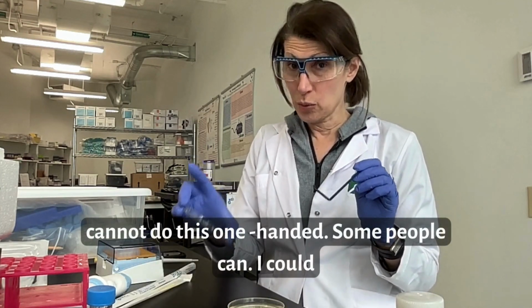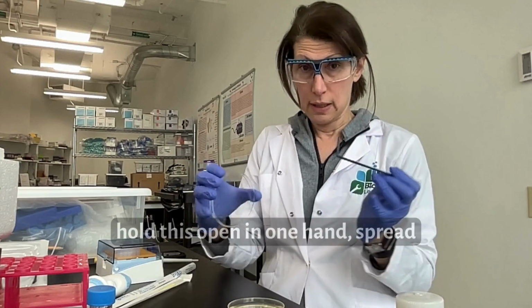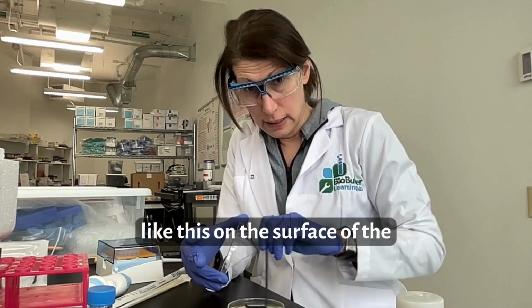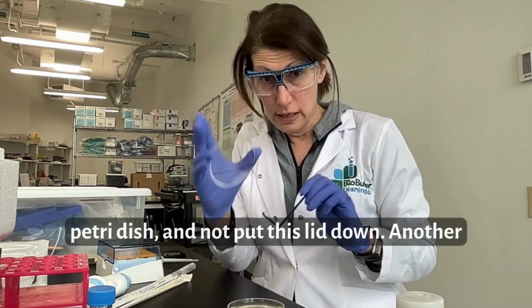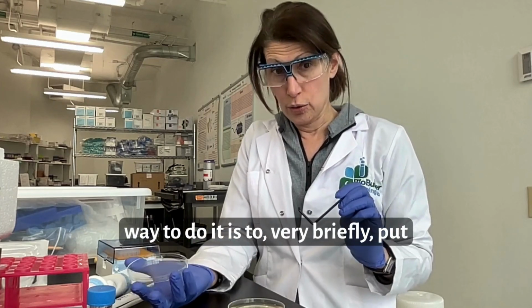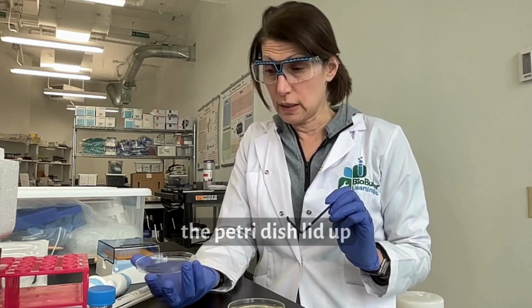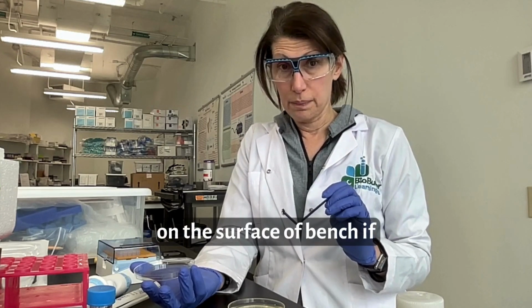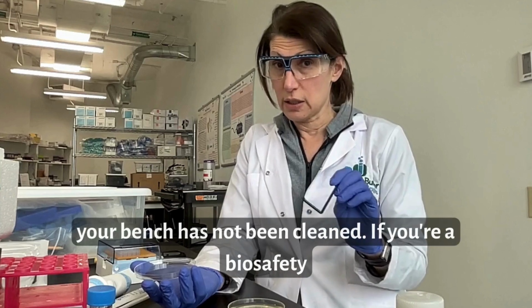I cannot do this one-handed. Some people can. I could hold this open in one hand, spread like this on the surface of the Petri dish, and not put this lid down. Another way to do it is to very briefly put the Petri dish lid up on the surface of the bench if your bench has not been cleaned.